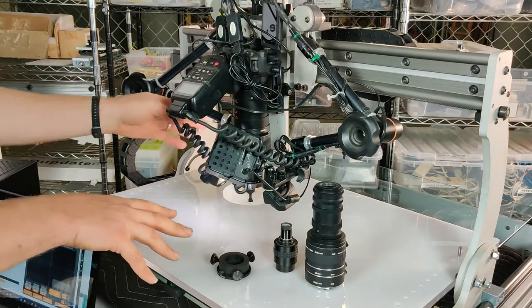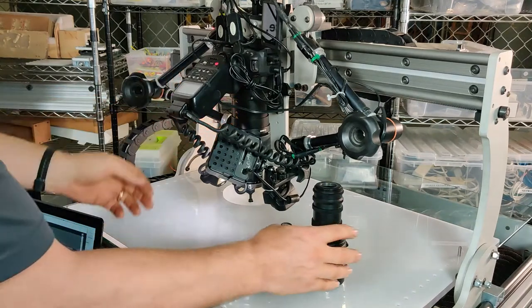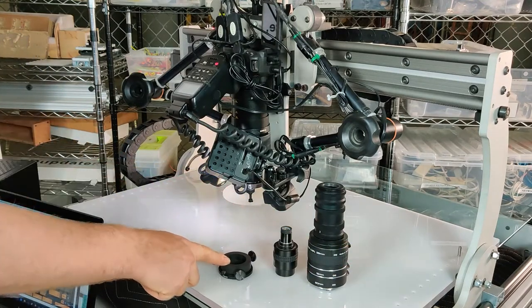I'm going to show you how to switch from this lens, the MPE 65mm lens, to the Nikon series telecentric lens, and also how to attach the diffusers to each one.